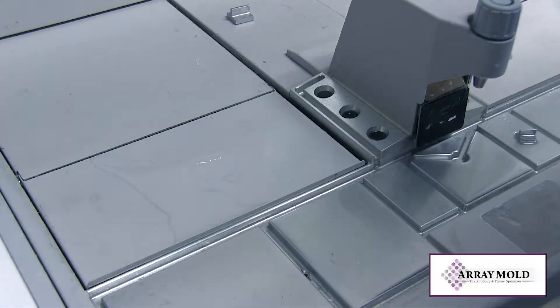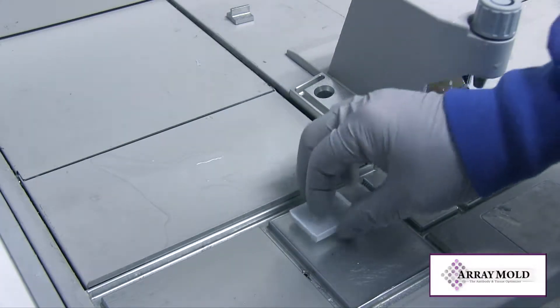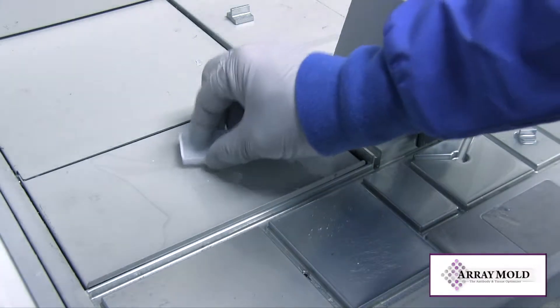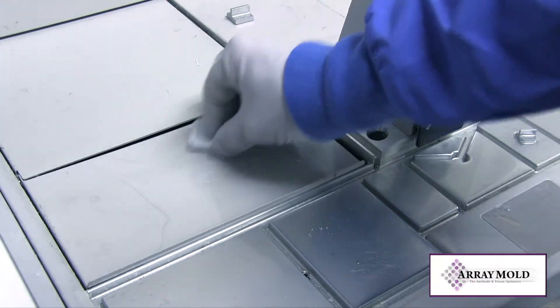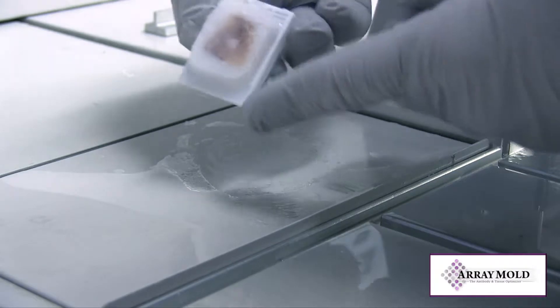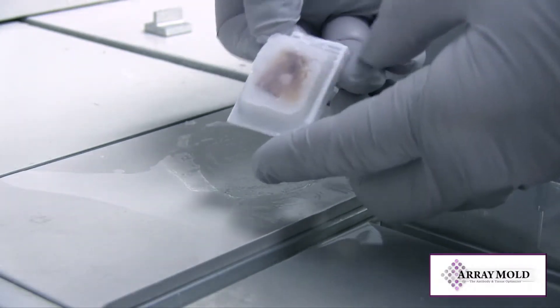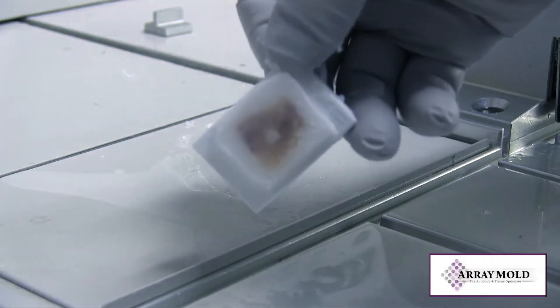I poured paraffin on a warm, hard surface so that I can use it to press paraffin into the holes of this paraffin block. This is a very simple technique, and a paraffin block can be repaired in less than one minute using this method. I allow the block to cool to room temperature before putting it on an ice block to cut.